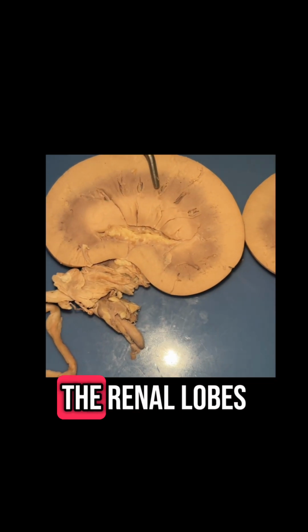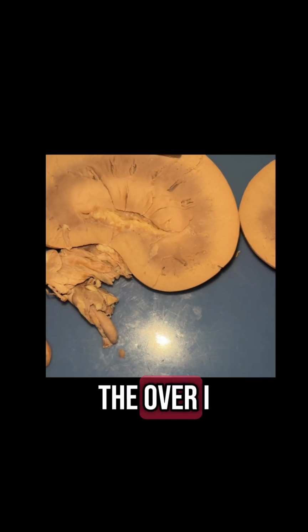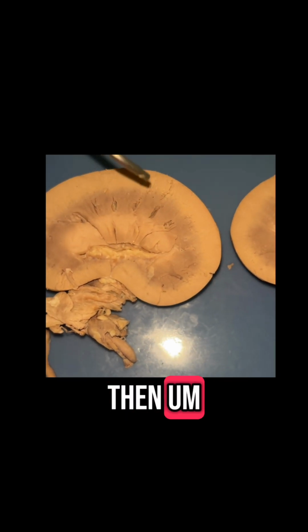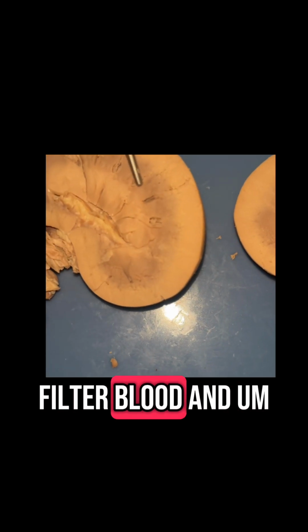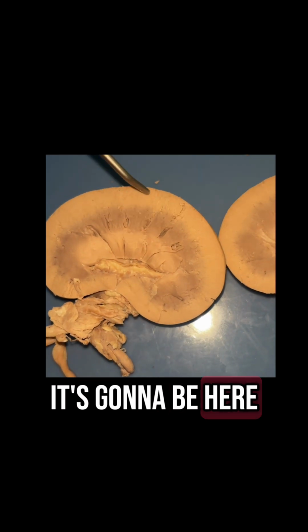Okay, next we have the renal lobe. So the renal lobe is going to be made out of one renal pyramid, the overlying renal cortex, and then a portion of the renal columns on either side. And these work to filter blood and produce urine. So it's going to be here. That would be a renal lobe here.